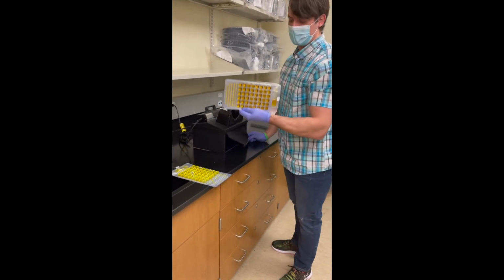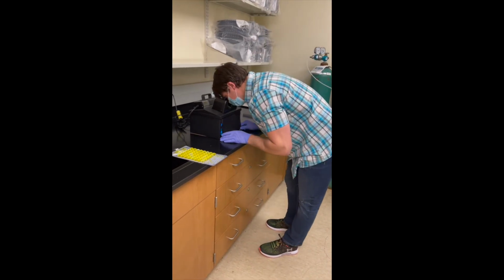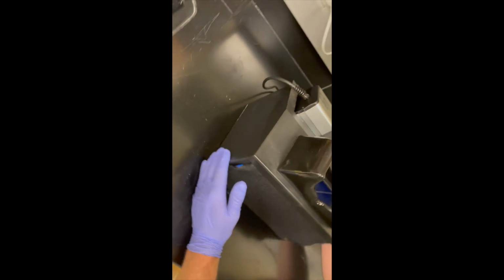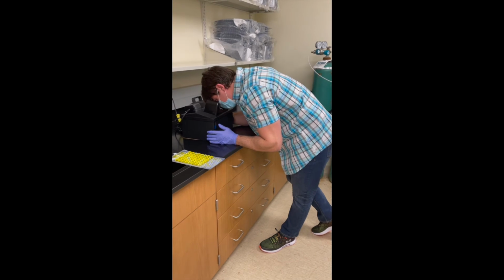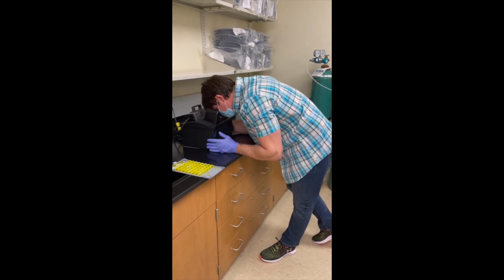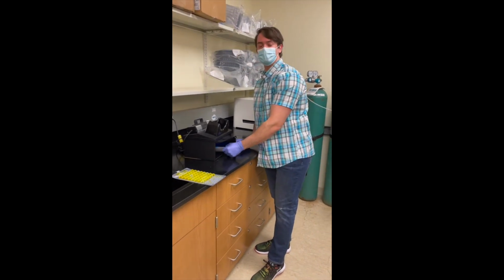Now moving on to a sample that is more turbid and probably has more E. coli in it. So here you can see a lot more of the small and large wells are positive. So you would note that number. Give me a second and I'll count them quickly. So the small wells are 5, and the large ones are 32, including the overflow well.